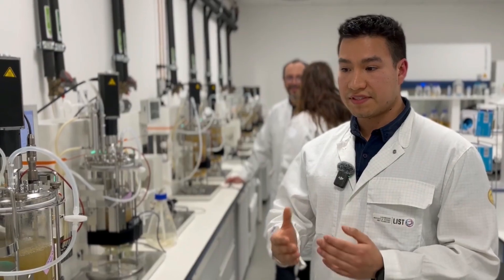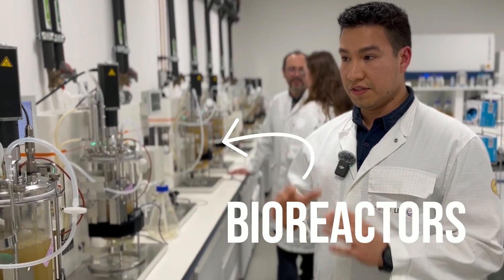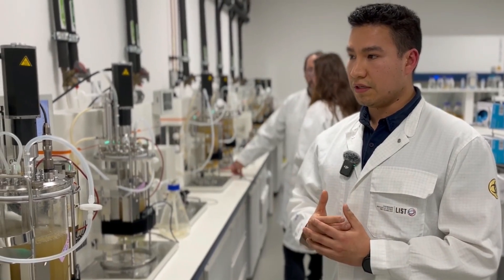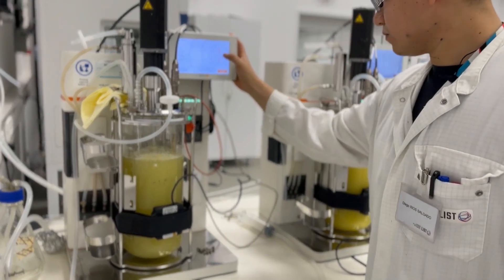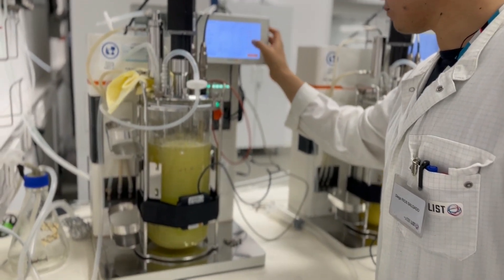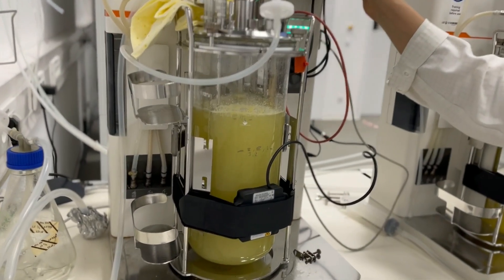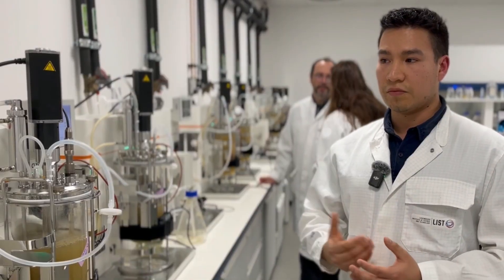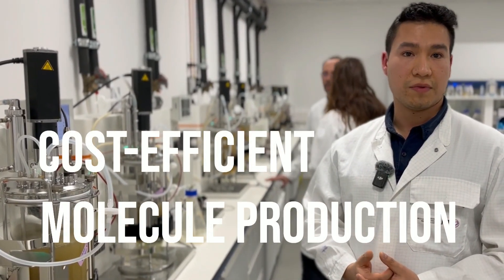We have several units of bioreactors here. In these units, what we do is we try to optimize the conditions that we have. We try to find the best balance in terms of temperature, agitation, and pH, in order to get the most cost-efficient production of molecules.